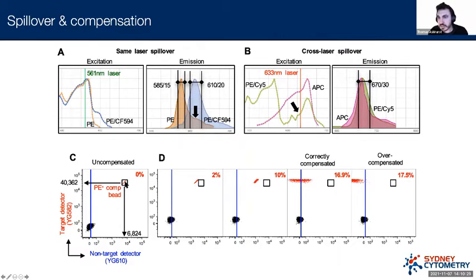Each dot on here, I realize this looks like a line, but it's actually a series of dots, and each dot represents a bead in this case, not a cell. They are labeled with PE, phycoerythrin, and so they should only be showing up in the PE detector, in theory, and not in another detector. But because we have this spillover event, the PE signal is going to show up in its own detector, but also the neighboring detector. We can see that it looks double positive. It looks like it's showing up in both detectors. So this is the problem of spillover. If it's showing up in one detector, it's going to show up in another detector to a certain amount.